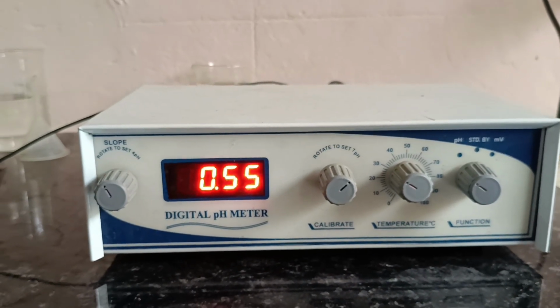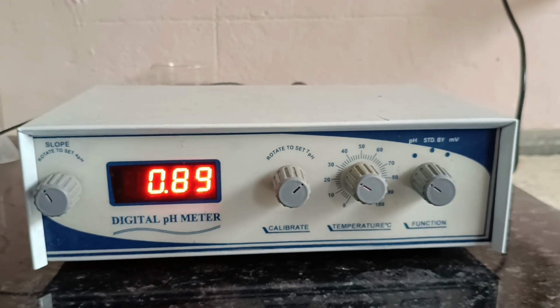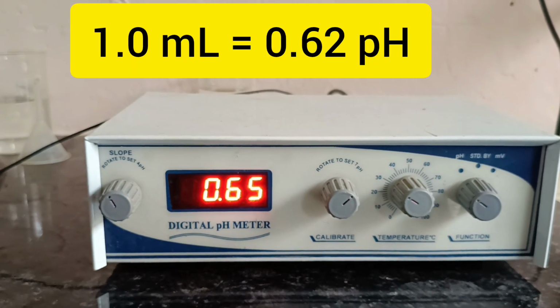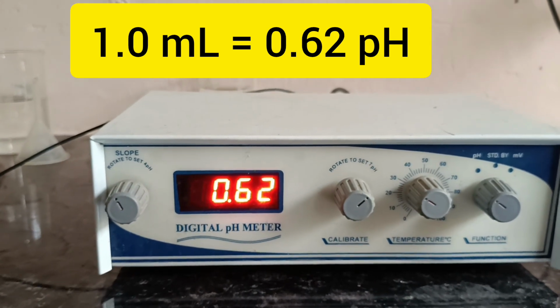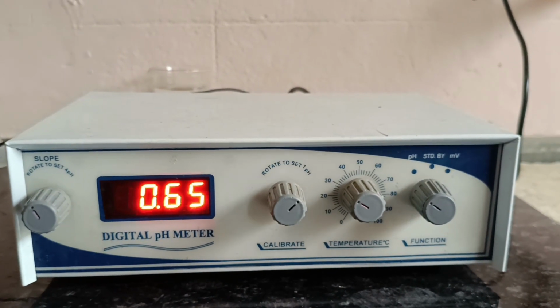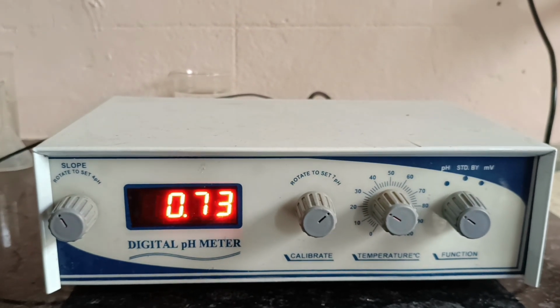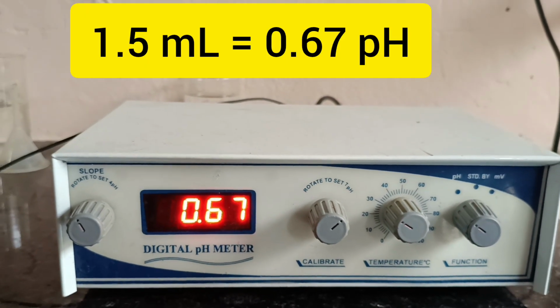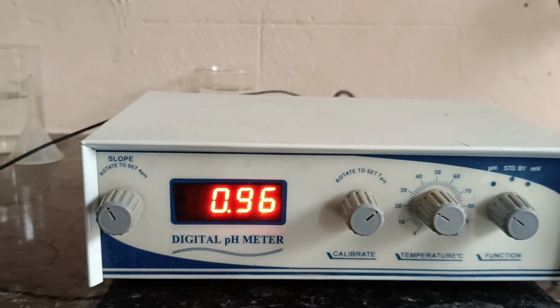So continuous addition of 0.5 ml from the burette is to be done, and after adding 1 ml the pH increases to 0.62. And 1.5 ml addition shows 0.67 pH. So we can see a continuous increase in the pH.